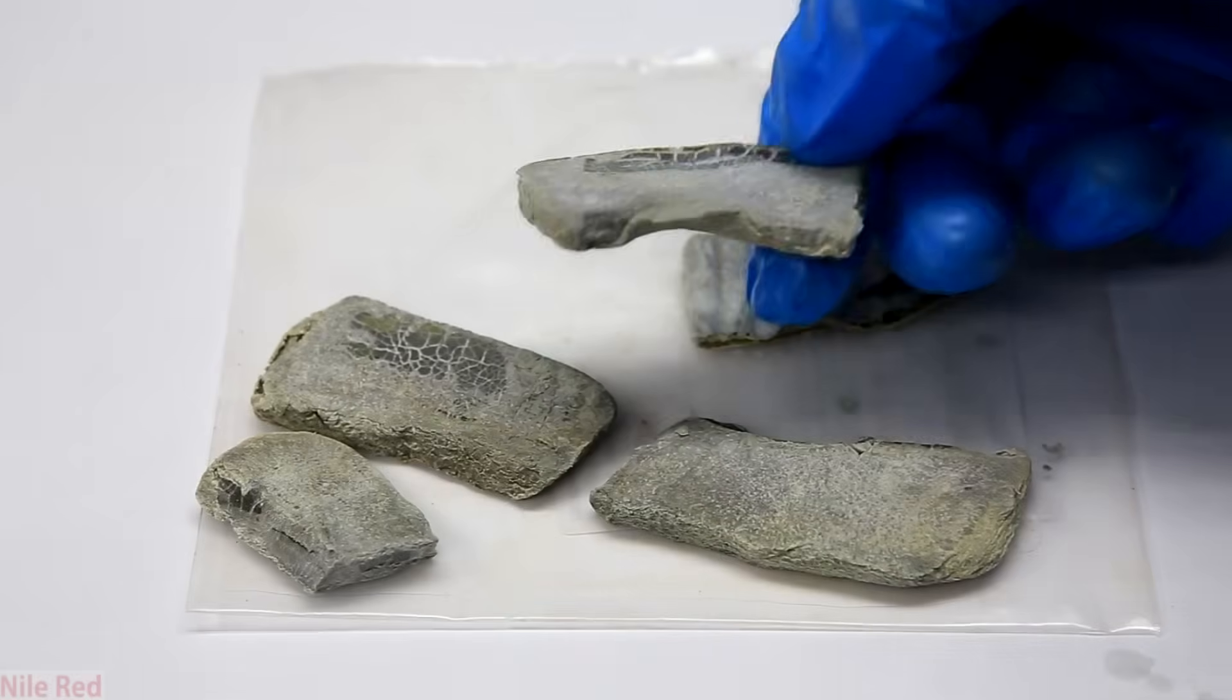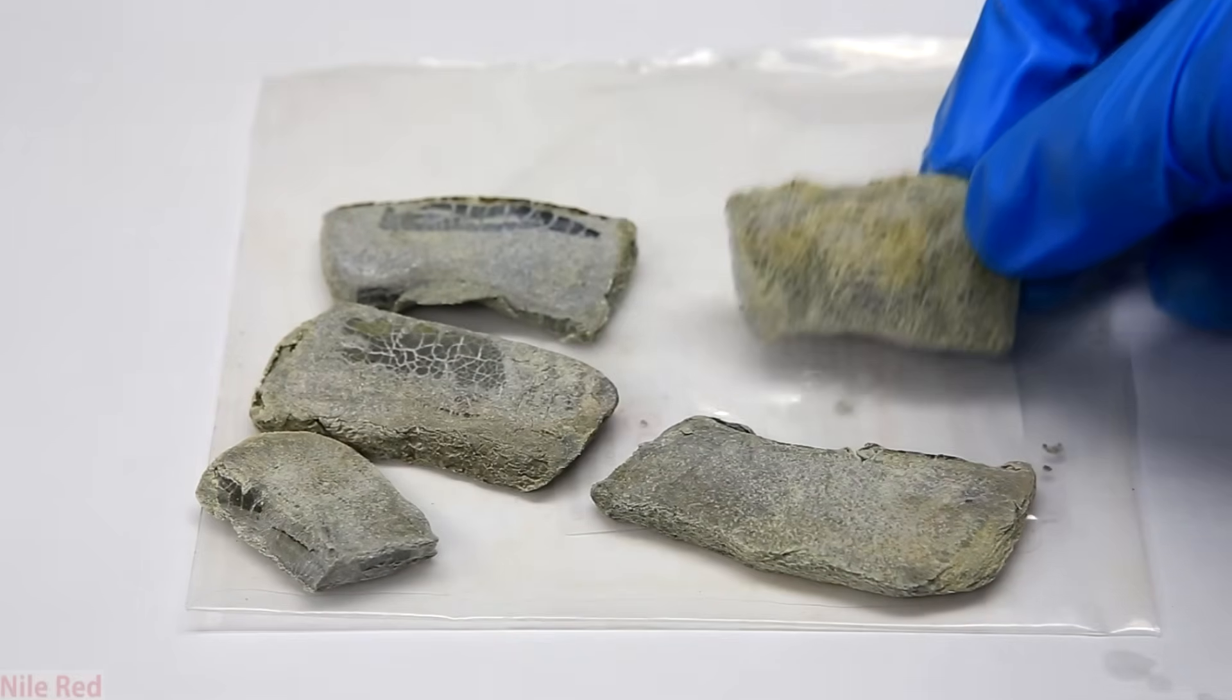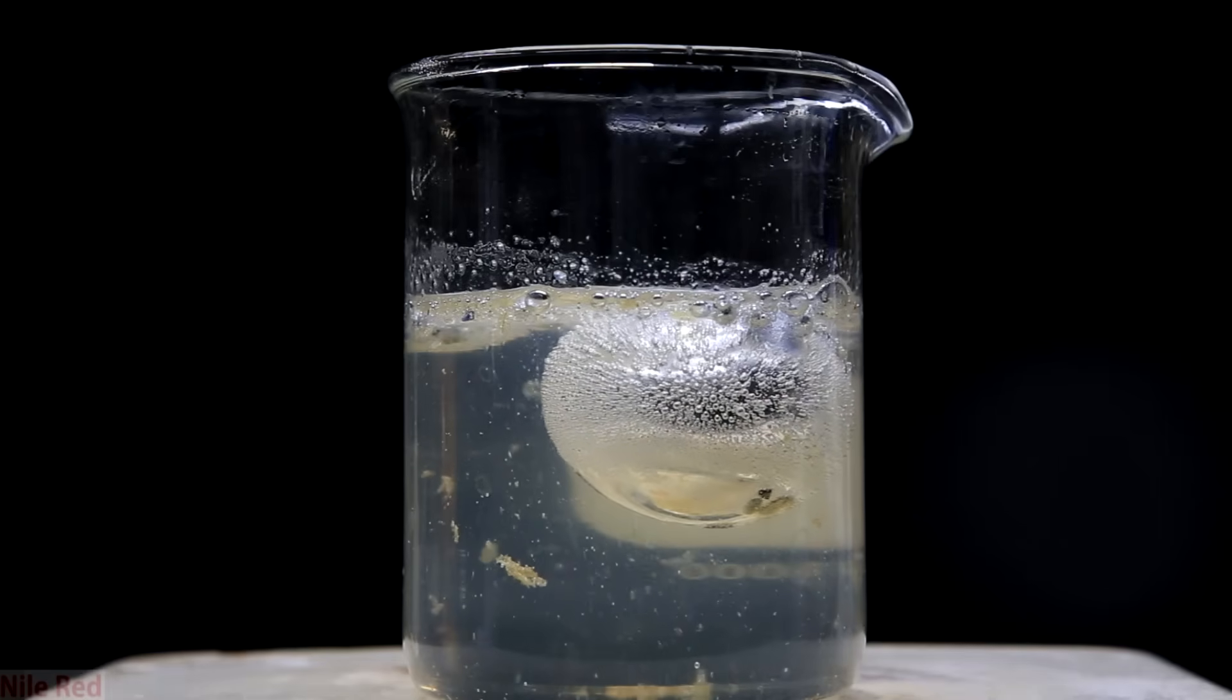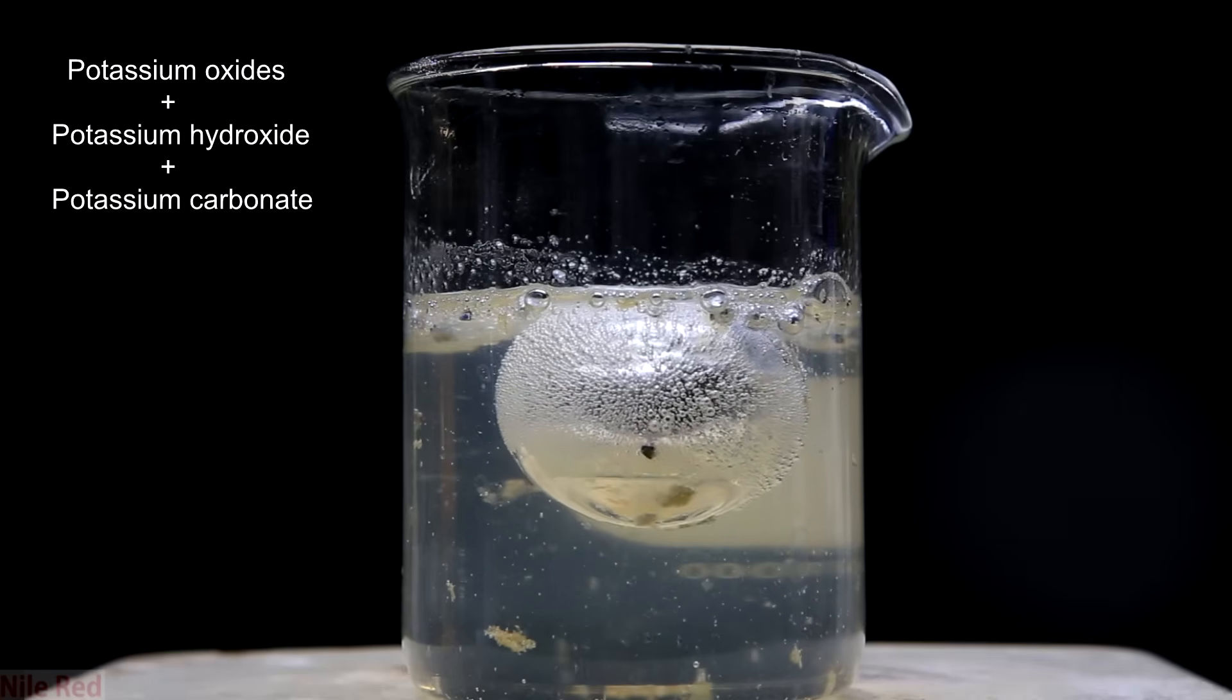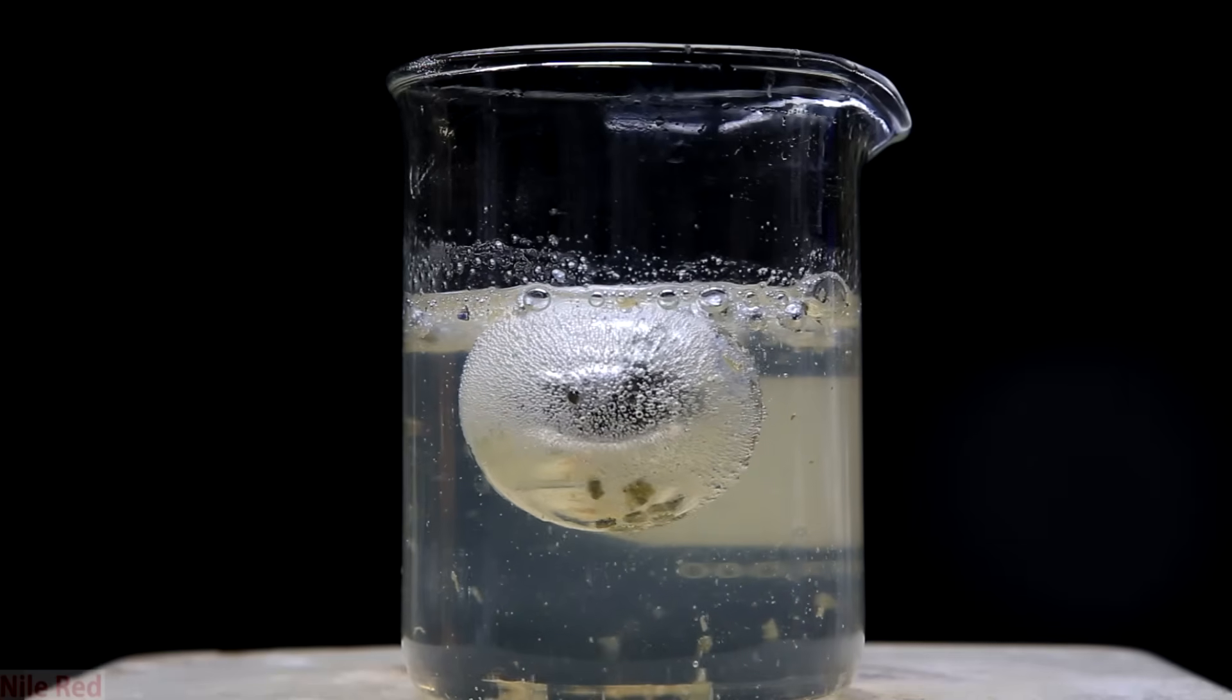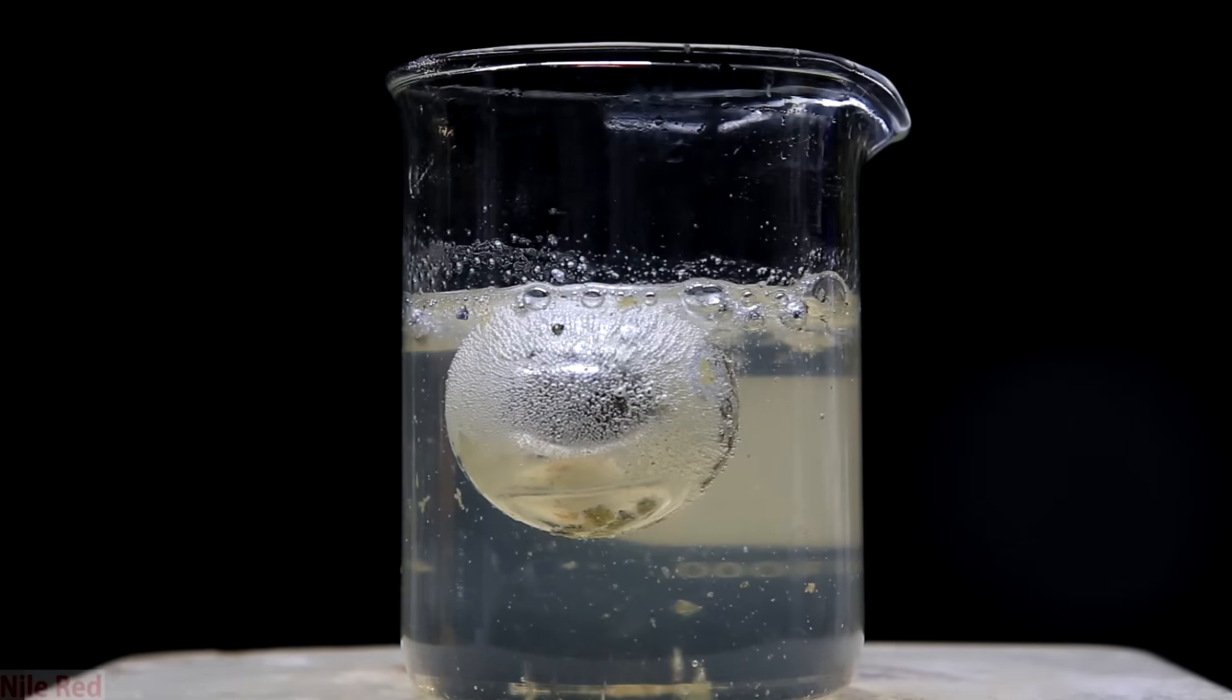Like sodium, potassium is an alkali metal and it's quite reactive. It reacts with water and oxygen and other things to get this coating on the outside. This layer on the outside of the potassium is a mixture of various potassium-based oxides as well as potassium hydroxide and potassium carbonate. If we're going to be carrying out a reaction, we want it to be nice shiny potassium metal and we don't want it to have this other stuff in the mix.